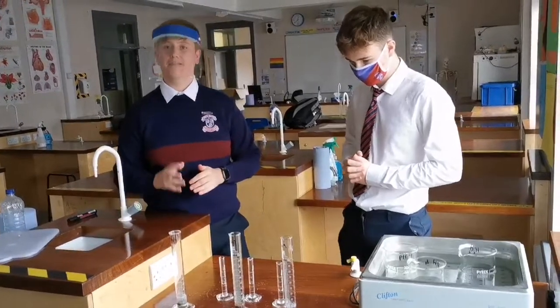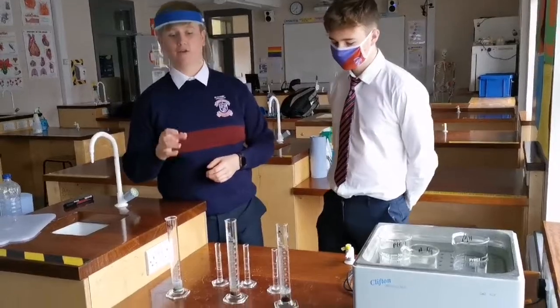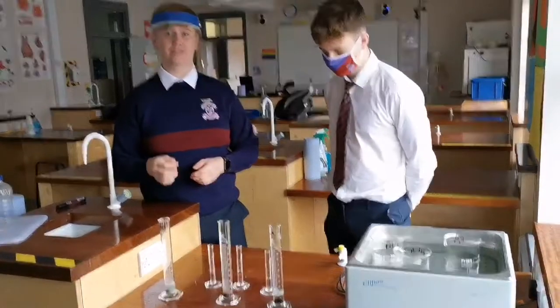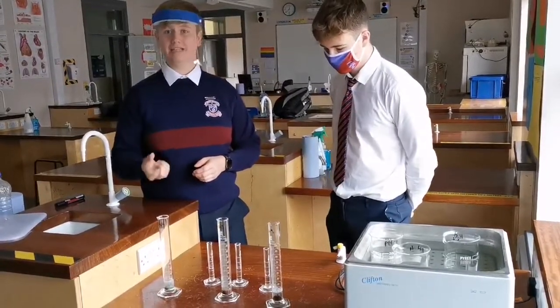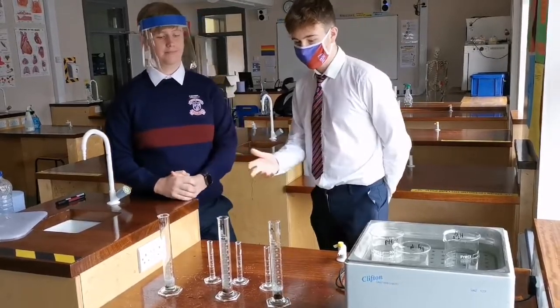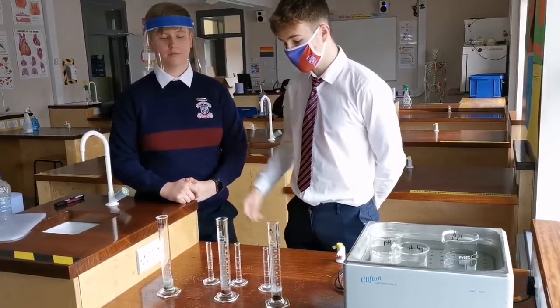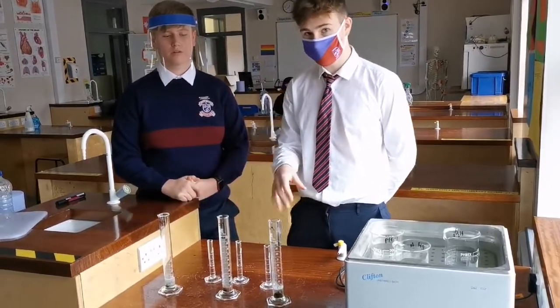Today we're investigating the effect that pH has on catalase. For the catalase, we're using a piece of liver in each one of these graduated cylinders. The liver is basically the exact same piece of liver that would be in your human body. In front of us we have three graduated cylinders for three different pH strengths: pH 4, 7, and 9.